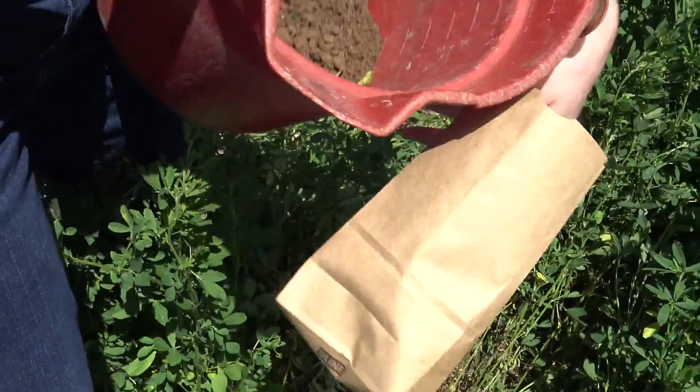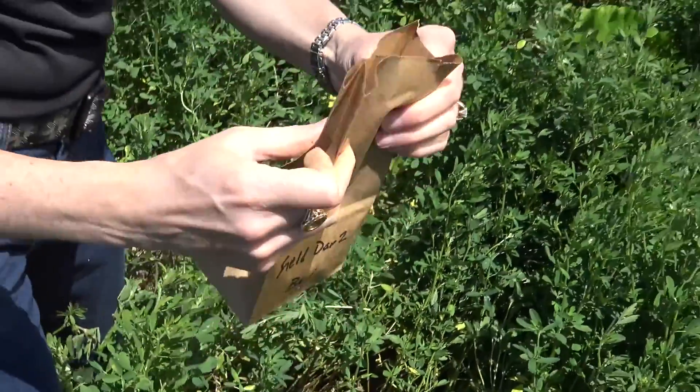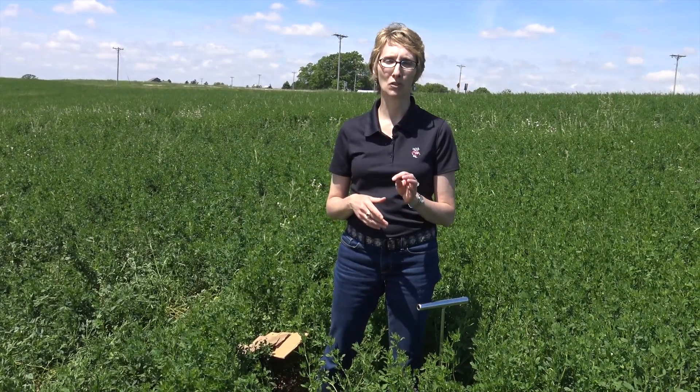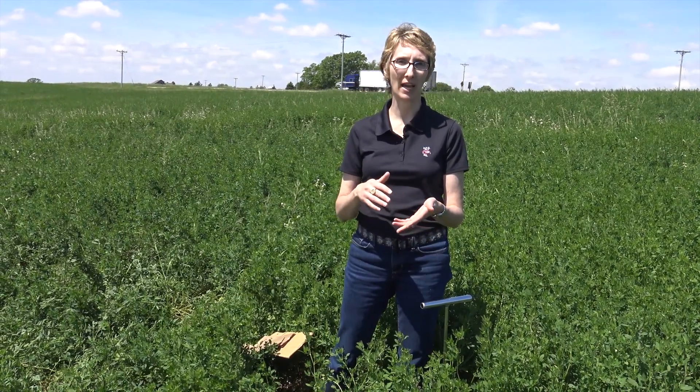A note on handling: if you're shipping the soil sample with the plant sample, we don't want moisture from the soil to get onto the plant. So while you might collect the soil into a paper bag, for shipping purposes you may want to package it into a Ziploc bag to keep the moisture contained within the soil. Also — and this is very important — if you're sampling somewhere closer to the ground, you might get soil splashed onto the plant or a lot of dust. Take a brush and brush off the plant to get the soil off, otherwise you'll get false readings on the tissue test. Do not — and I repeat — do not wash the plant with water, as that can leach nutrients out and cause problems with the results. Just brush off the plant before packaging it and sending it to the lab.